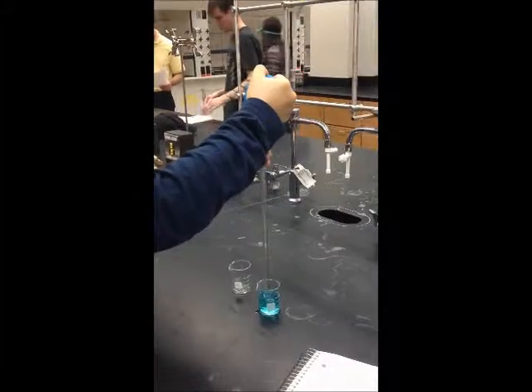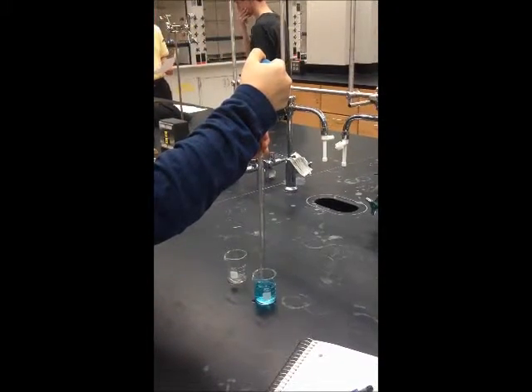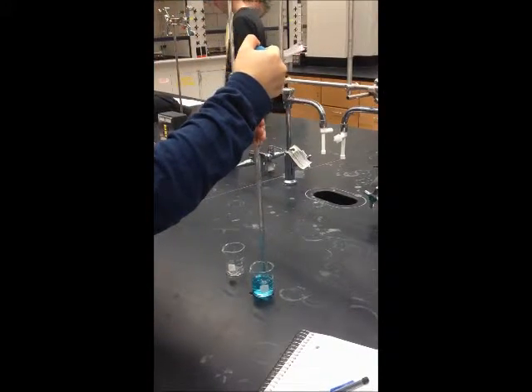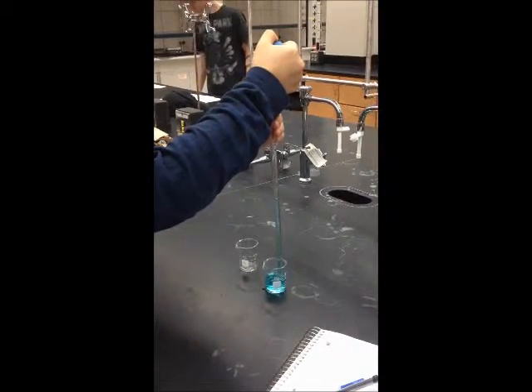Squeeze the pipette bulb and gently place it on top of the pipette. Release the bulb to uptake the desired amount of solution, and to stop it, quickly take the bulb off the pipette and place your thumb on the top of the pipette to contain your amount of solution.